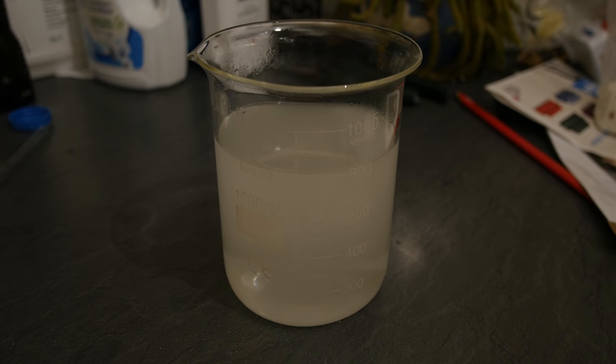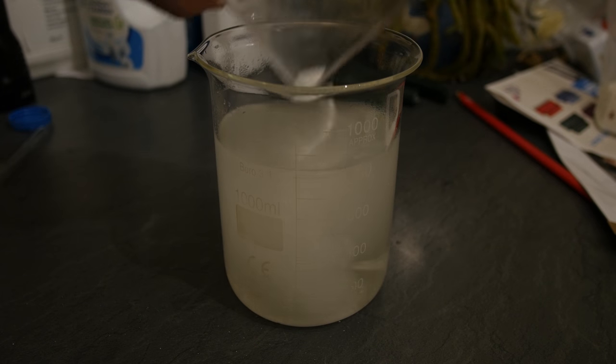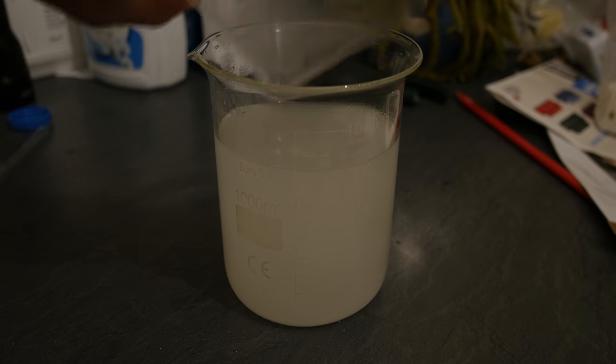Once that's dissolved, add 20 grams of sodium tetraborate decahydrate, and then stir again.